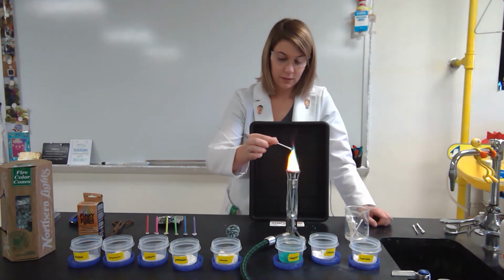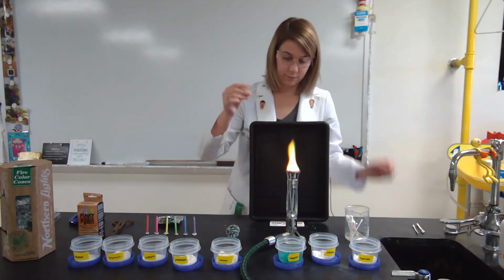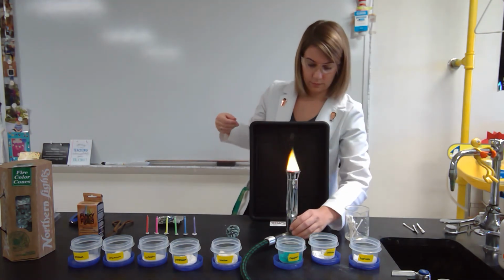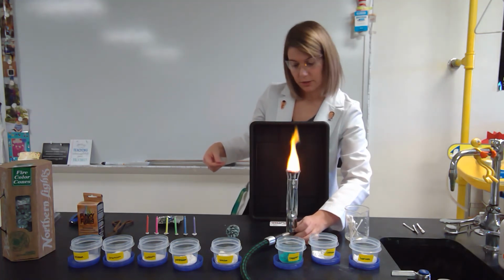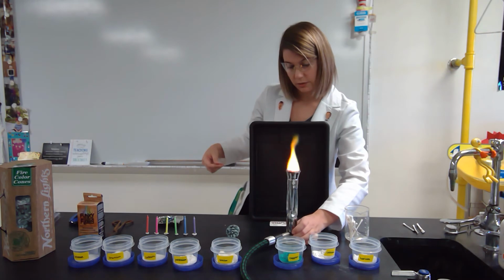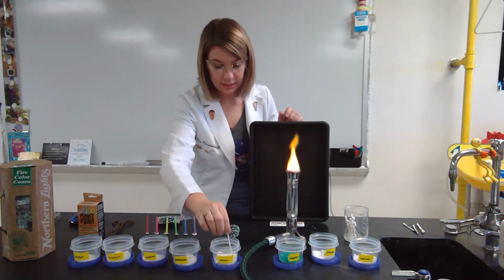copper. And hopefully you can kind of see at the tip of this flame, the copper is on the inside, it is blue in color, and it is green on the outside. So copper is a green, or it is a blue, or a blue-green. This Bunsen burner just does not like me today, which is fine. The next element we're going to test is lithium.